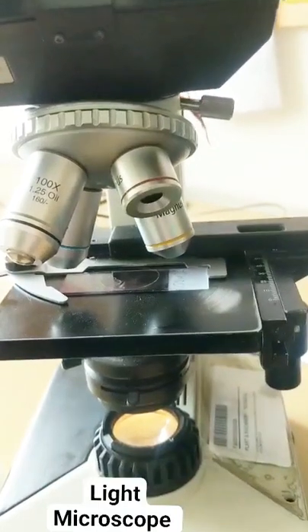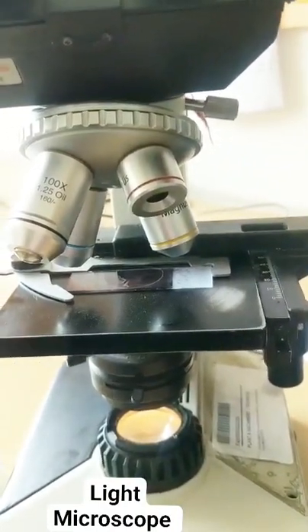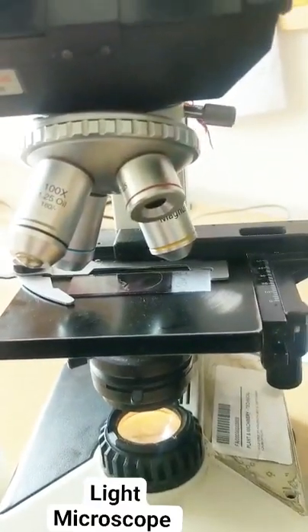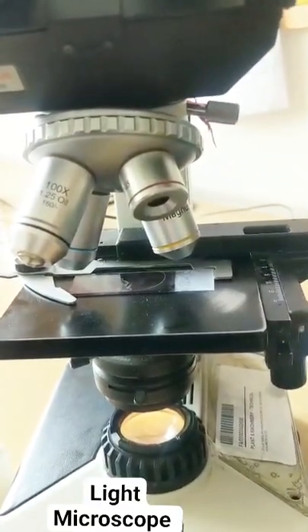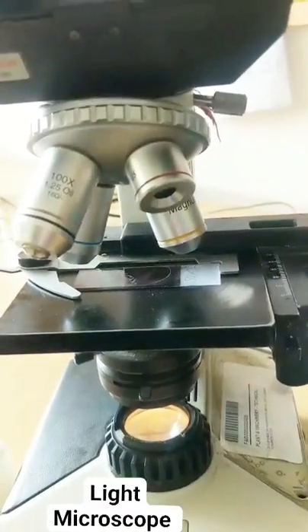And lastly you have 100x written. So what are the four magnifications? 4x, 10x, 40x, and 100x. What is written on the 100x? Oil. So this is the one that you will use when you have to see something in oil, like the hematology slides.